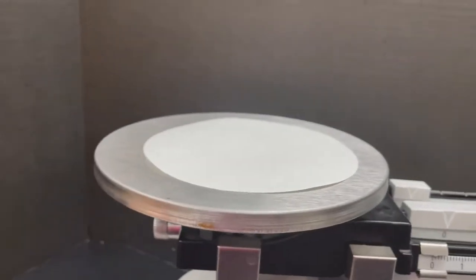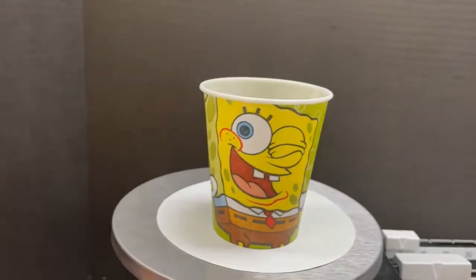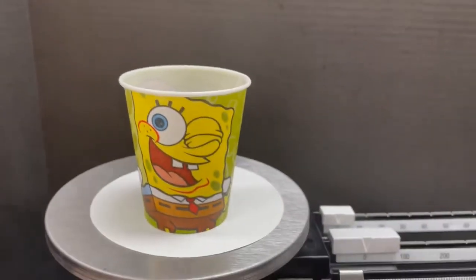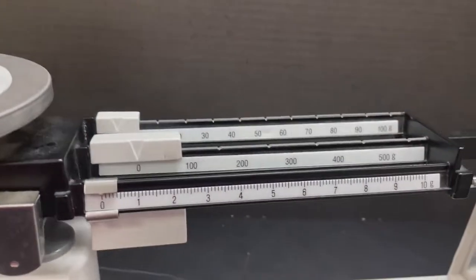What we're going to do is take our Spongebob cup and put it on the tray that has many little weights in there. We will then proceed.